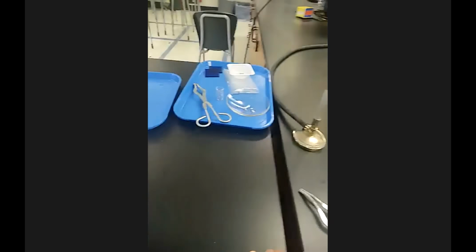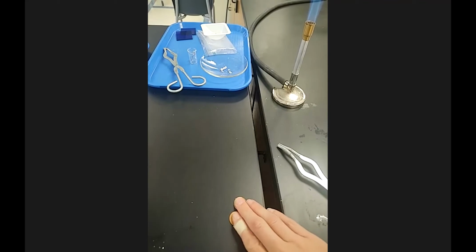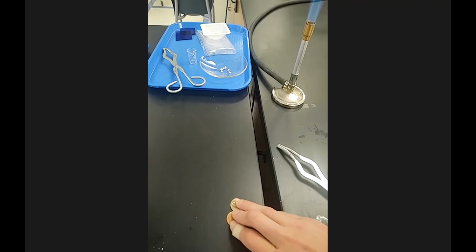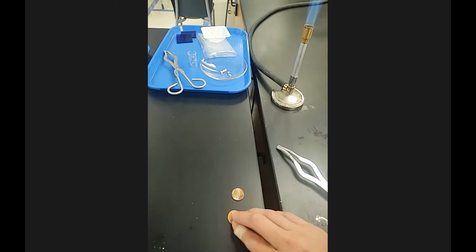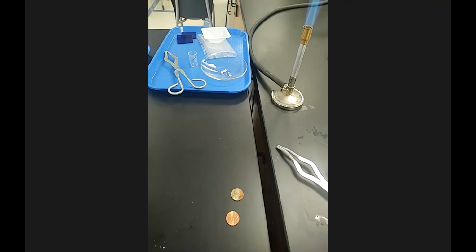If I was feeling both of these at the same time, I would think I'm touching something different. Okay. Because it definitely feels different. Now as it's cooling, it is a little bit smoother and it's not quite as tacky, but it definitely was a minute ago. But this one is still definitely smoother than this.